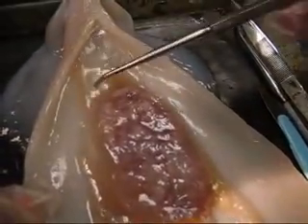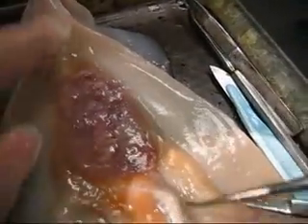If you can't see it, there's going to be a vein running through the middle of it. This red thing is food. And there's a hard portion over here, which is the pen. The whole thing runs to the side.